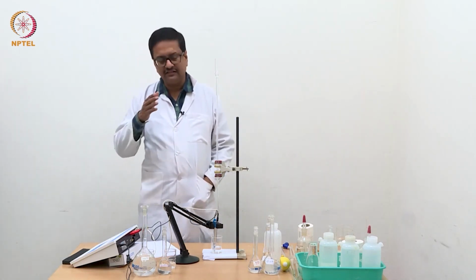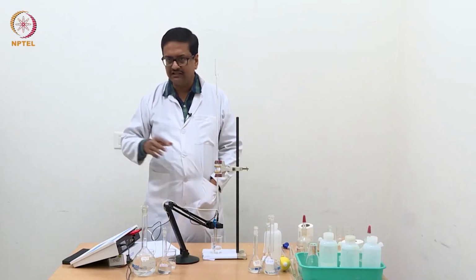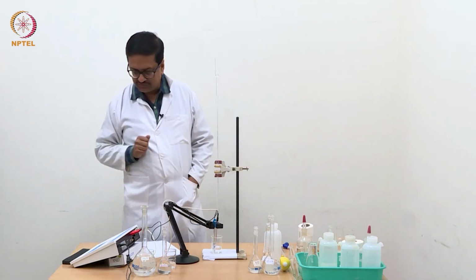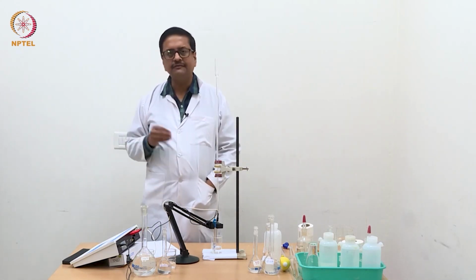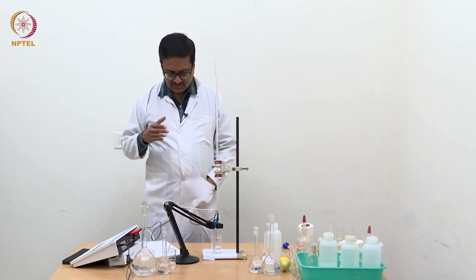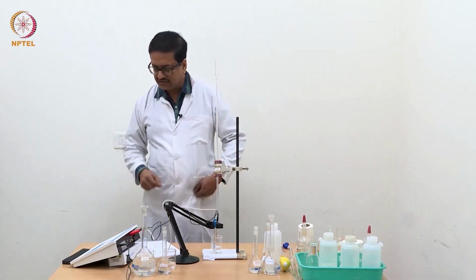But in this case, it gets reduced, then you wait for a while, the acetic acid dissociates and compensates for the consumption of H+, reaches its equilibrium, and then you are able to see a stable reading in the conductivity meter. So here you have to be very patient and do this experiment carefully with smaller amounts and letting this solution equilibrate and give you a stable conductance value.